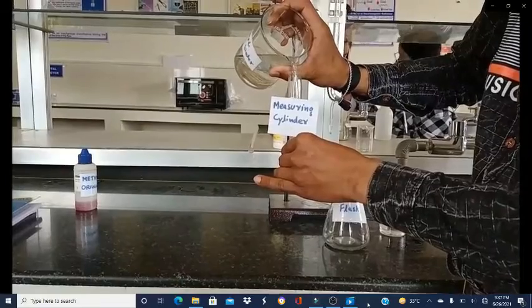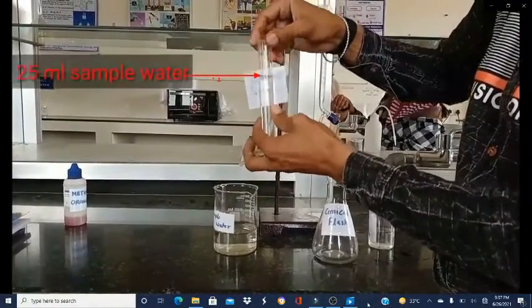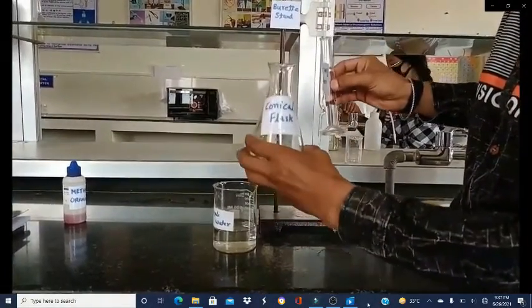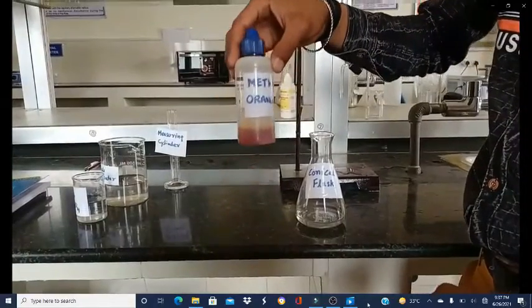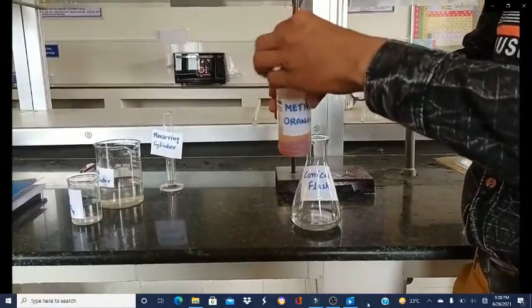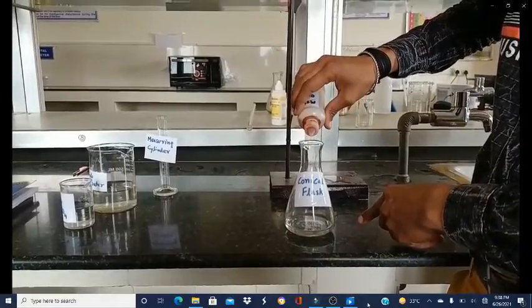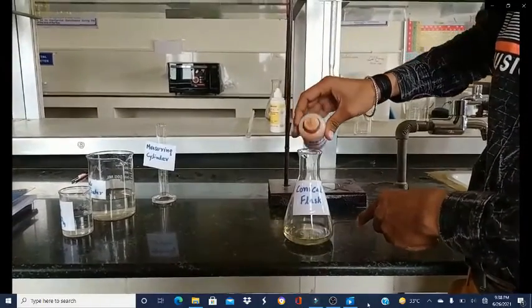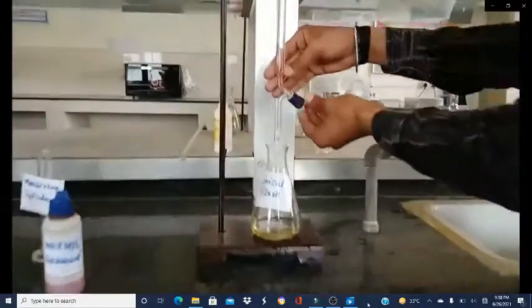Now we will measure the water sample using a measuring cylinder. We will read the lower meniscus. The quantity of this water is 25 mL and we will transfer it to the conical flask. To this solution we will add one drop of methyl orange as an indicator. Here you can see the color — it is yellow in the basic range.